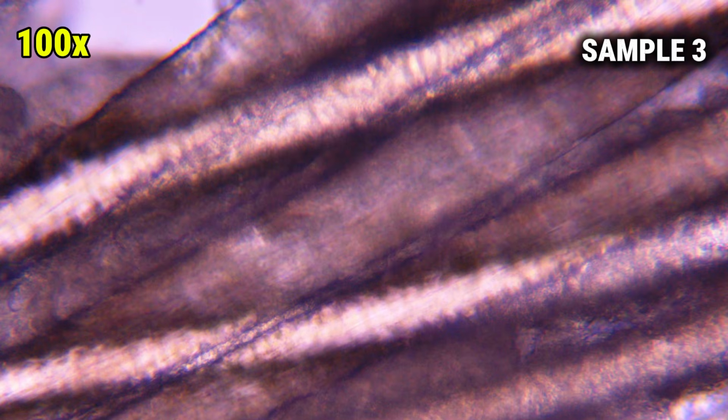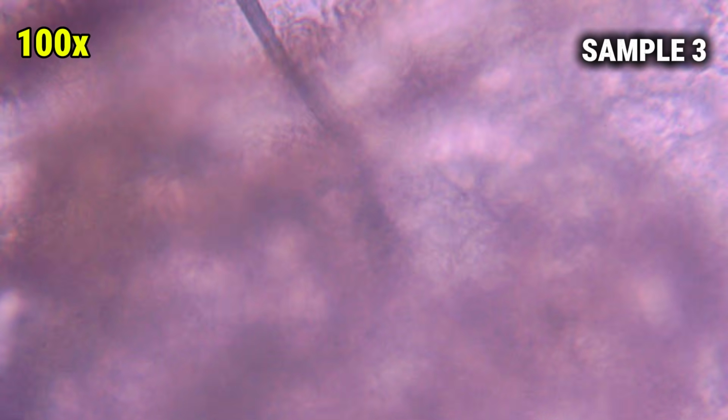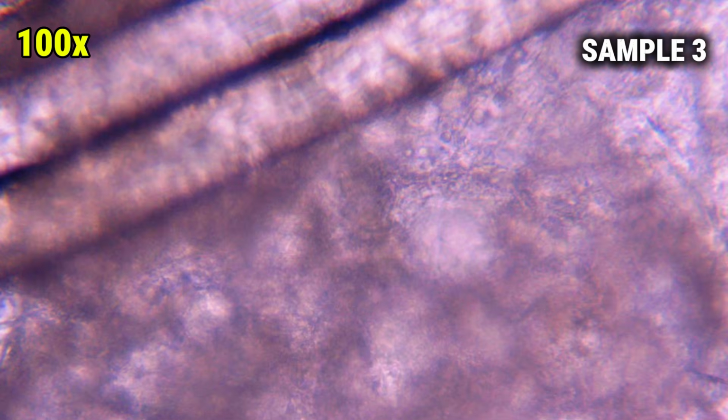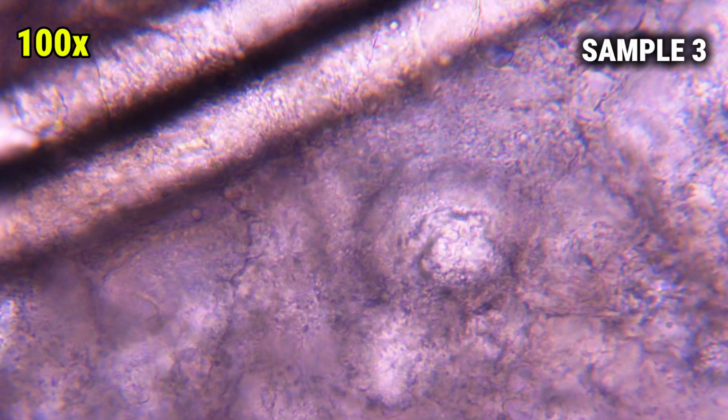Those are areas where the material is more densely packed with oil and skin debris, which makes them appear darker under the microscope. So what we're seeing here is essentially the internal structure of a pore plug, stretched out and magnified enough that we can actually see the fibers that held it together inside the pore, which is fascinating and gross at the same time.